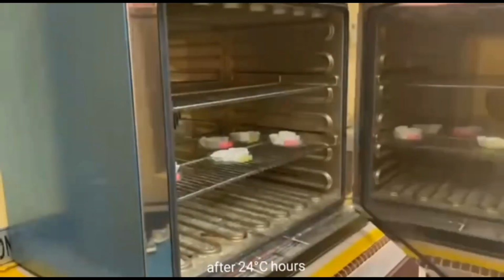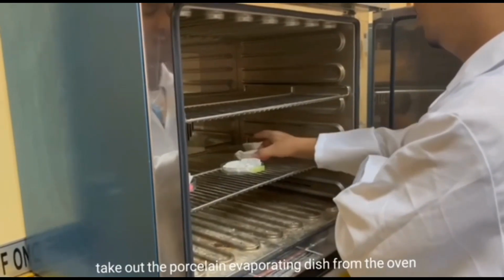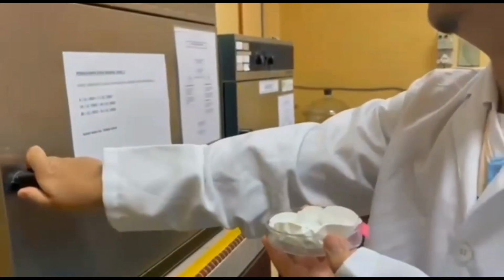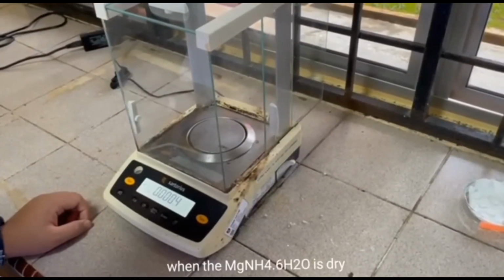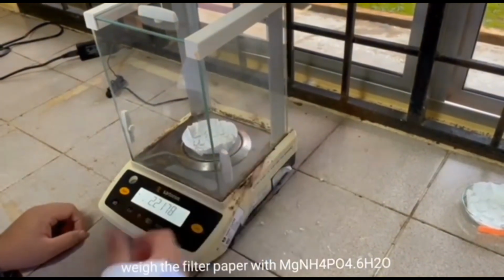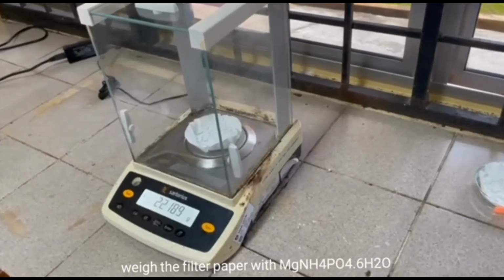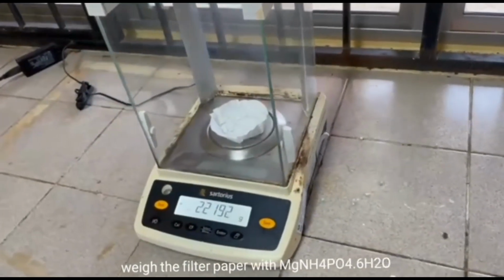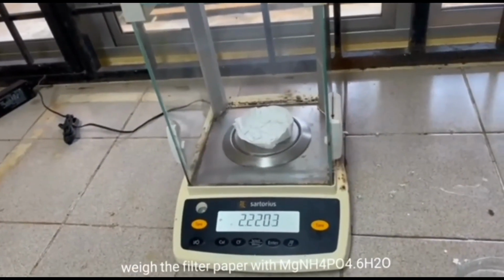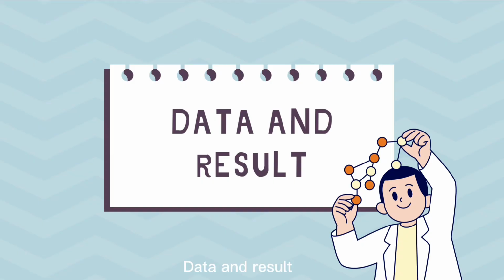After 24 hours, take out the porcelain evaporating dish from the oven. When the magnesium ammonium phosphate is dry, weigh the filter paper with the magnesium ammonium phosphate. This experiment is done. Data and result.